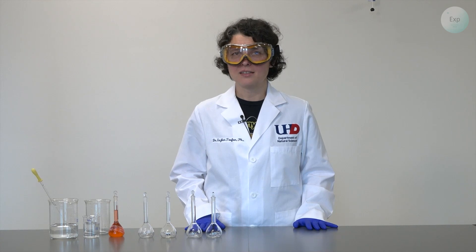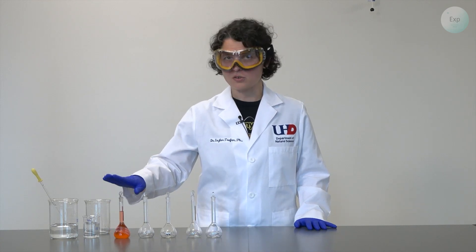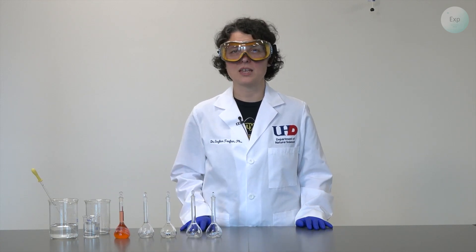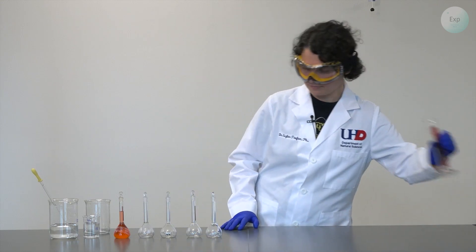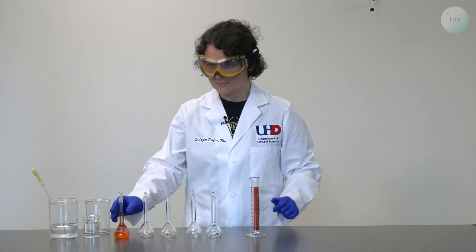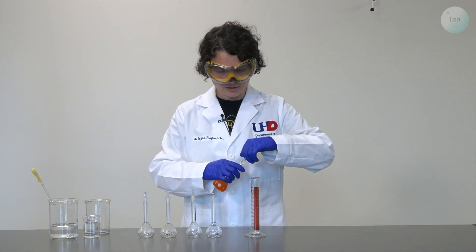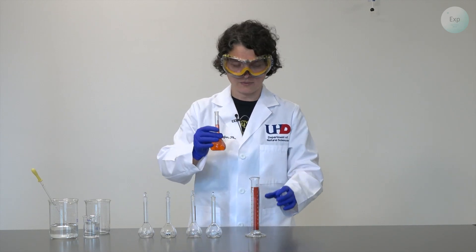Because I am measuring the volume of my original stock solution, I will need to use a graduated cylinder. So for these measurements, we will use 35 milliliters of our stock solution.